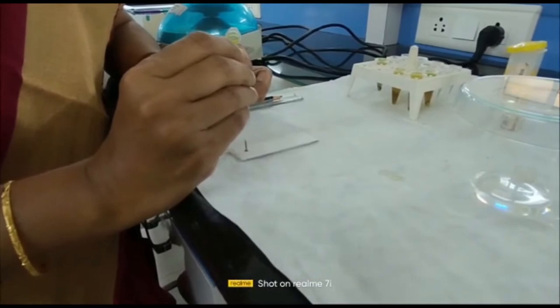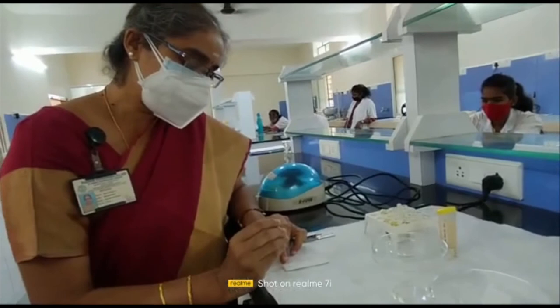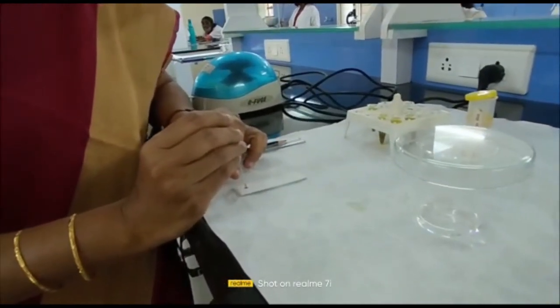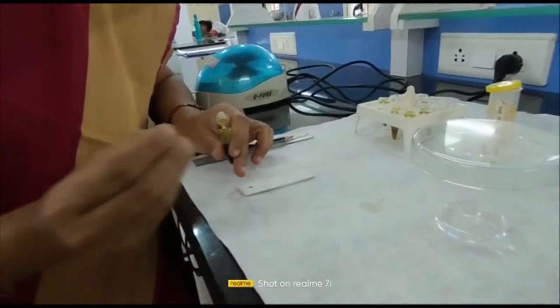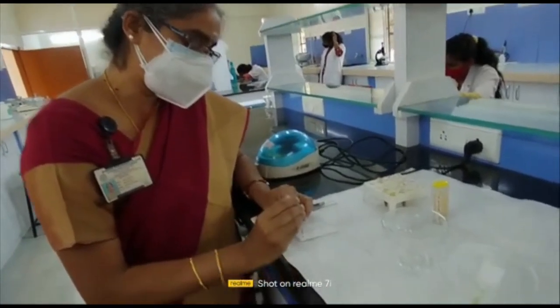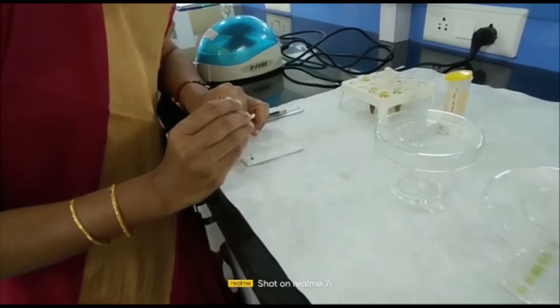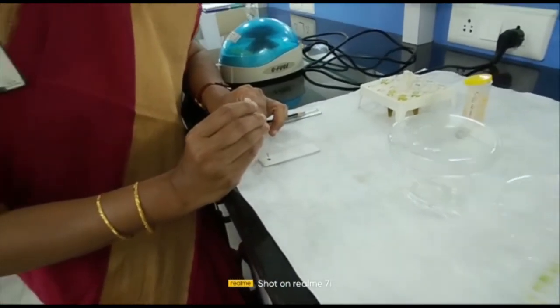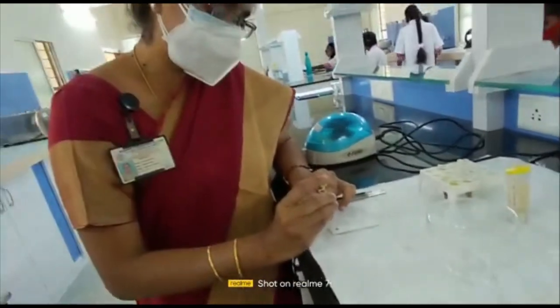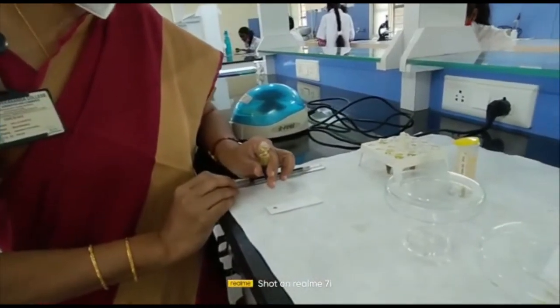Apply the spot a few centimeters from the bottom end of the plate. Slowly intensify the concentration by repeatedly applying to the same spot so that the concentration of the sample will be higher and you will be able to view the separated plant pigments more clearly when running in the mobile phase. Spotting of the sample is now done.